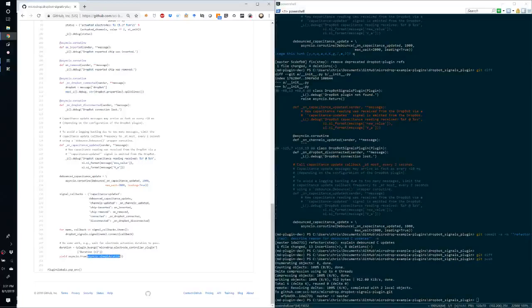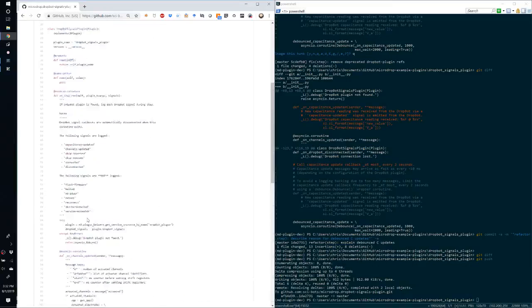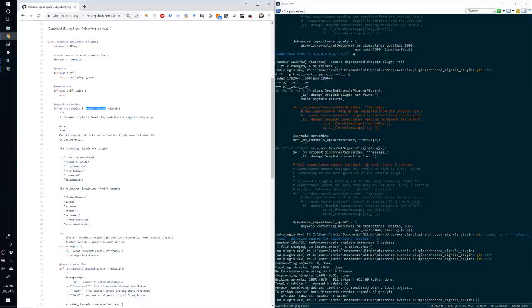But here, so we get yield, and then the trollius is renamed to async I/O .from, and then in this case we're just sleeping for the duration specified in the electrode controller plugin. So this is in the protocol table. You'll see the duration seconds. So we're just accessing that value from the plugin keyword arguments, and that's what was passed into the onStep_run function.